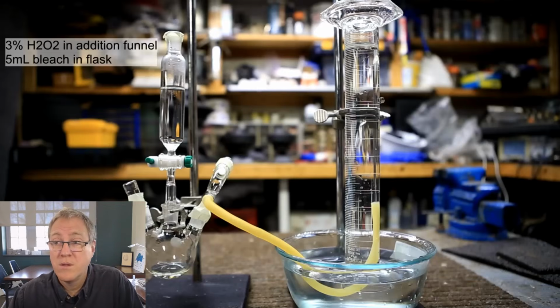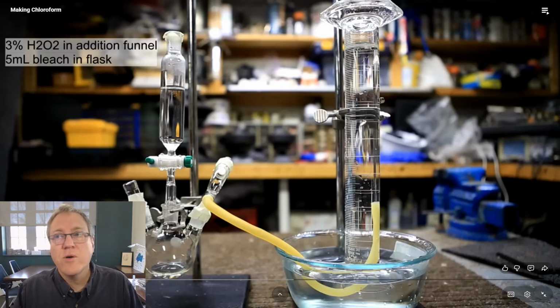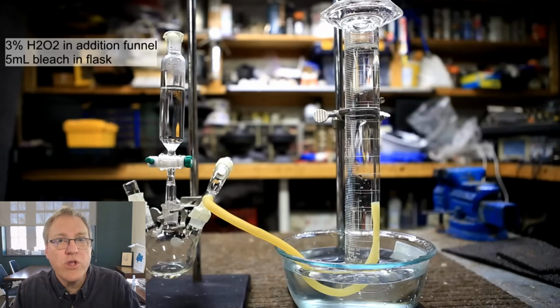The first thing that must be done is to determine the concentration of sodium hypochlorite in the bleach. Okay, so he's going to use bleach. Bleach is not pure sodium hypochlorite. It is a solution, and that solution has a concentration. If you look on the side of a bottle of bleach, it'll tell you the concentration. But I wouldn't trust that concentration, and I don't think NileRed trusts that concentration.